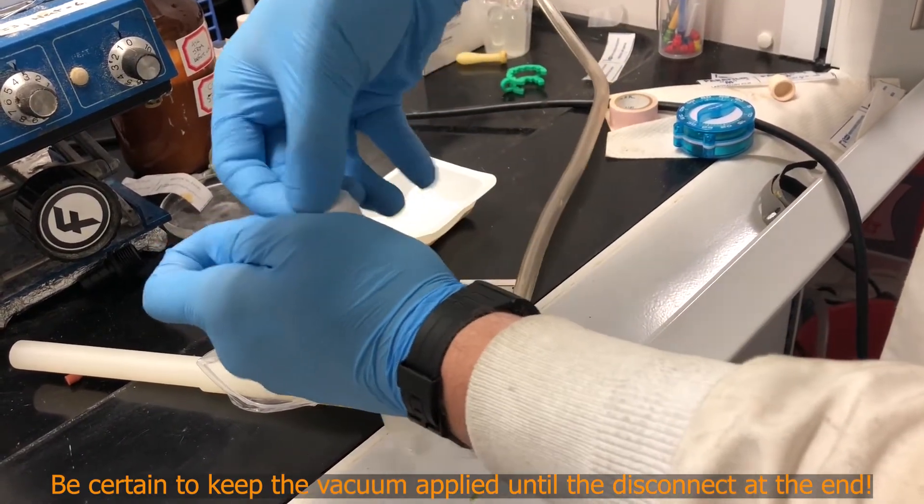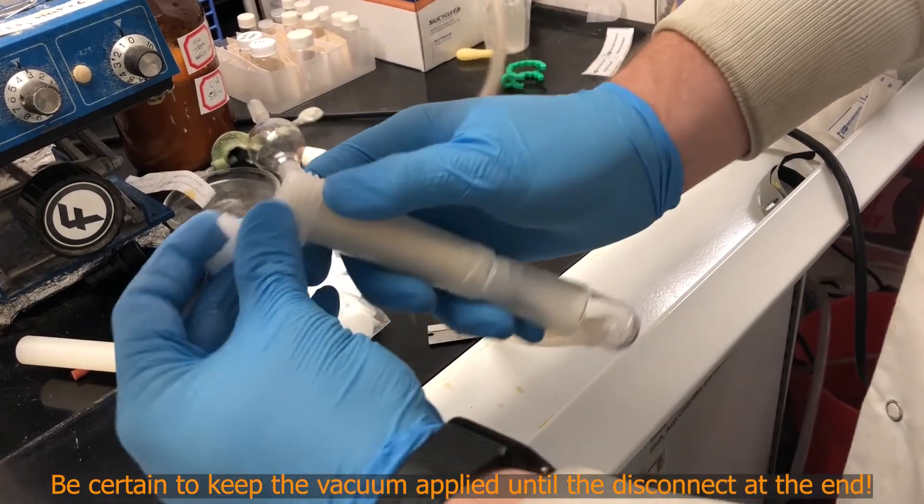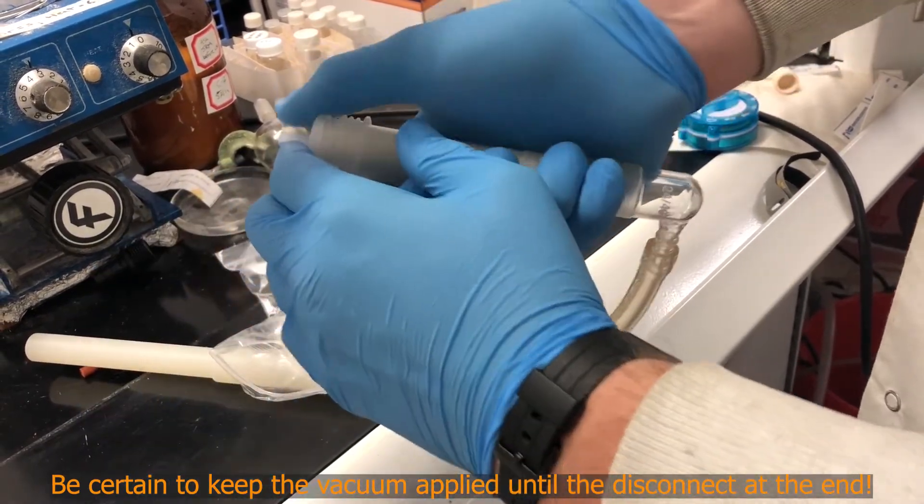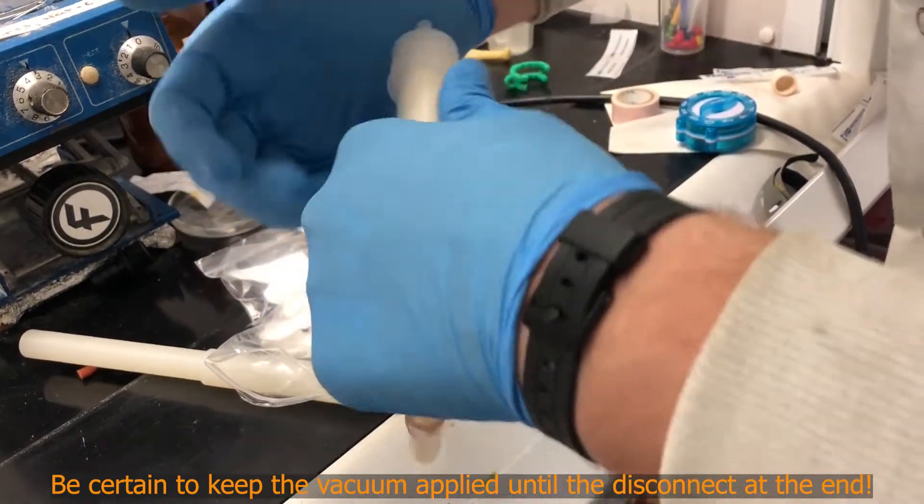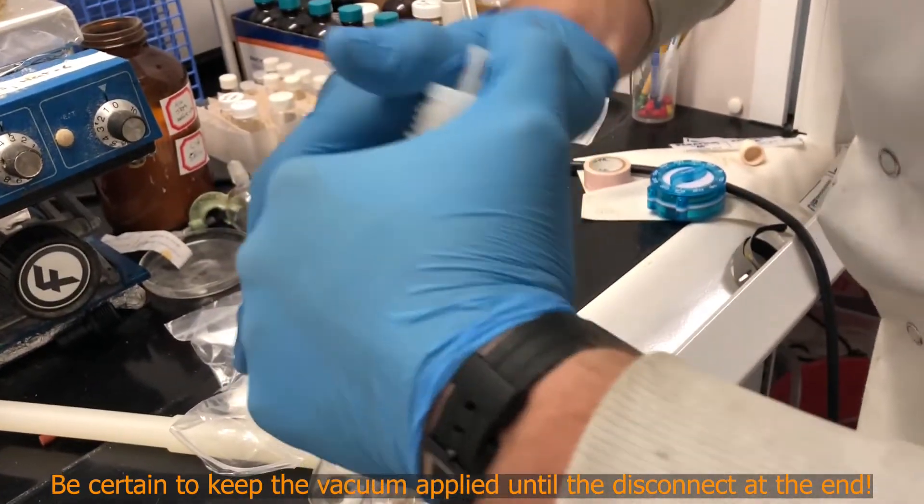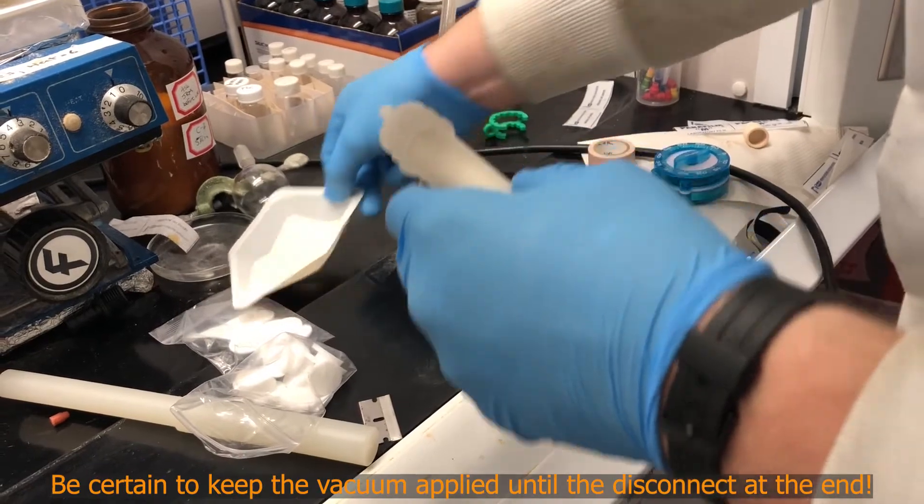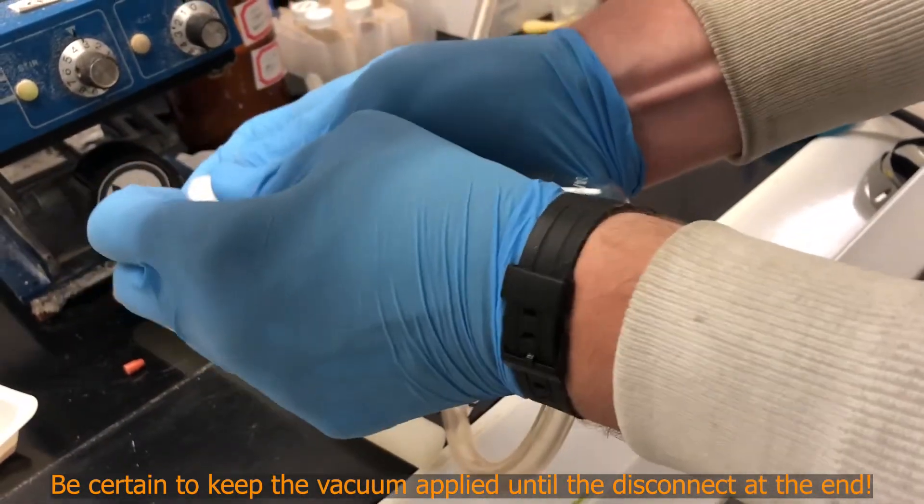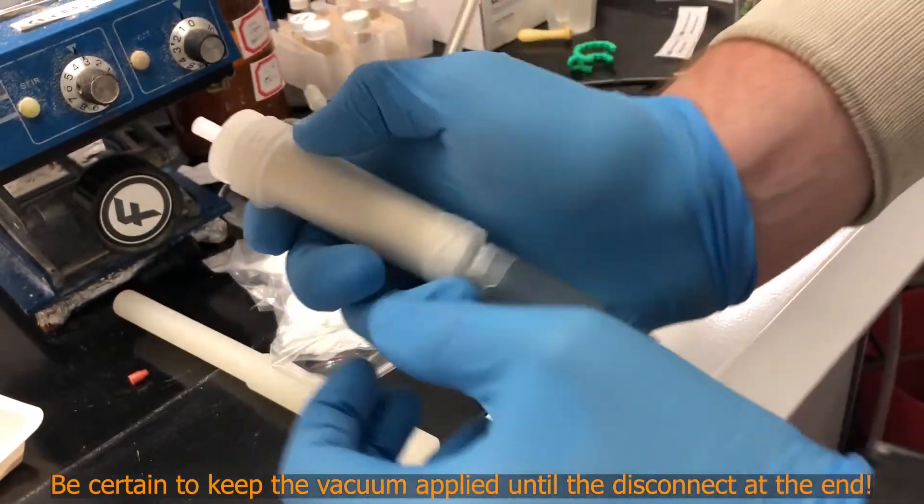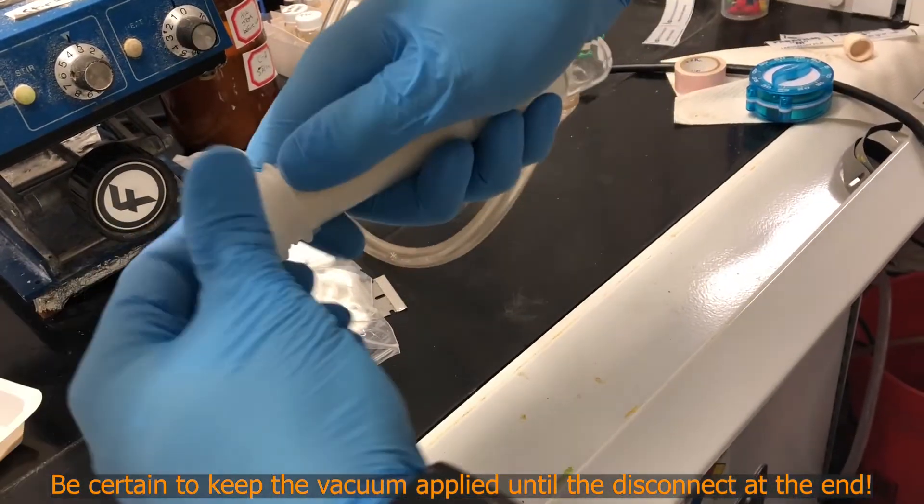Let's try this again. Put the frit in, place this top cap on. You hear that click? Got to make sure we get the click all the way around. It's sitting on there flat. You're just going to take this and screw it on.